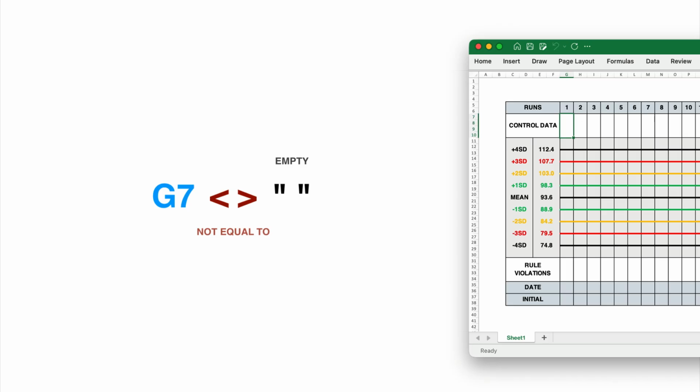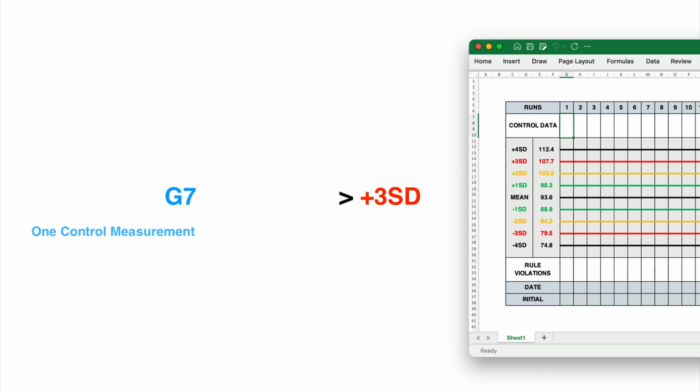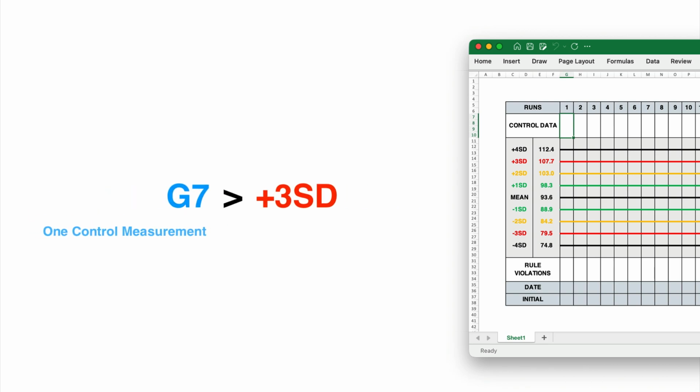Next, we move on to the actual rule check. There are two possible ways a value can violate 13S. Condition 1. The value is higher than the upper limit, which is mean plus 3 standard deviations. In our sheet, that upper limit is stored in cell E14. So if G7 is greater than E14, condition 1 is true.